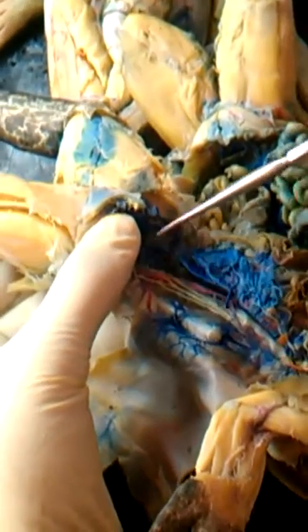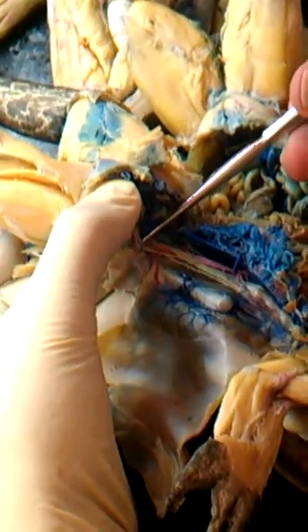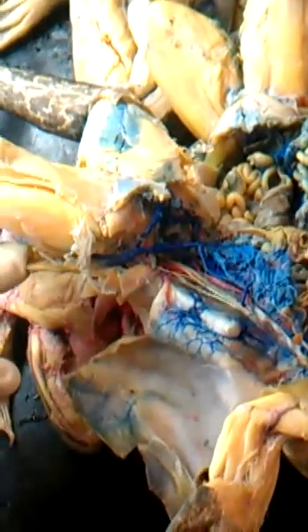Then once that branches off, you can see the beginning of the sciatic right now. Whoever did this did a really good job of dissecting. And that's a bit of the sciatic, but you saw it better down there. And that's all the arteries.